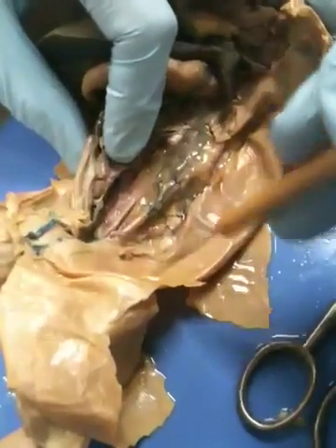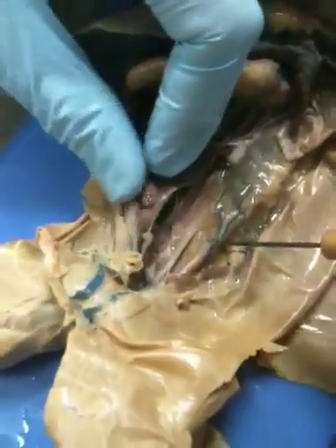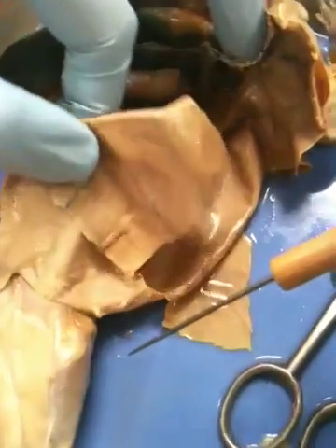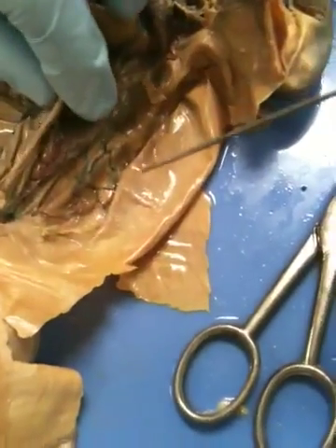We have the, let's see what else we have. I think that's decent. Yeah, that's good. Okay.